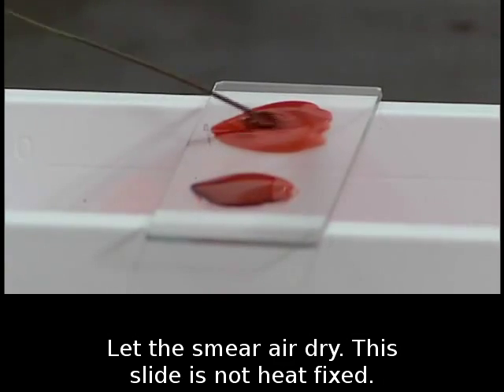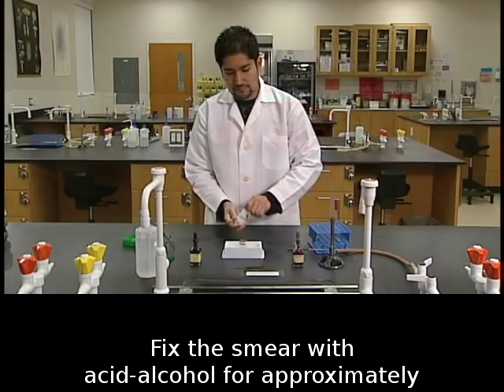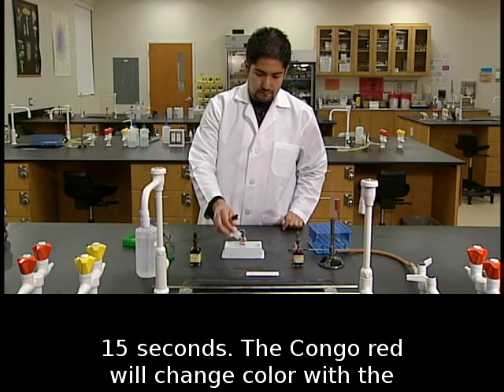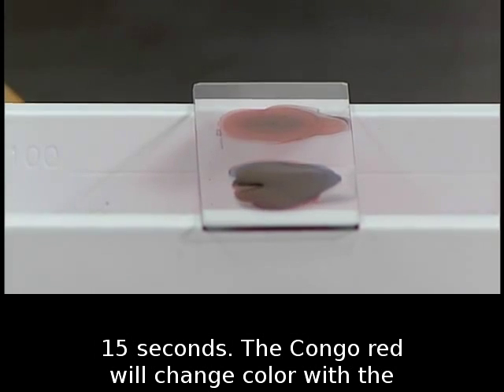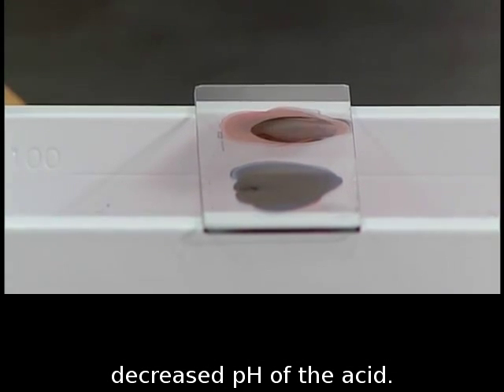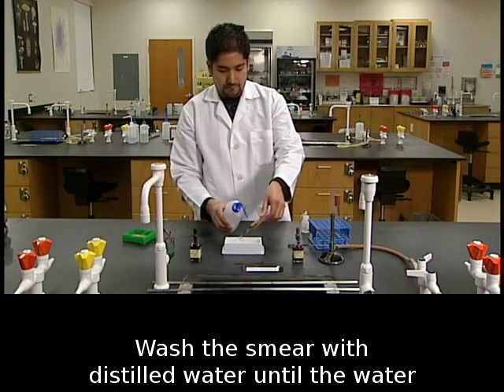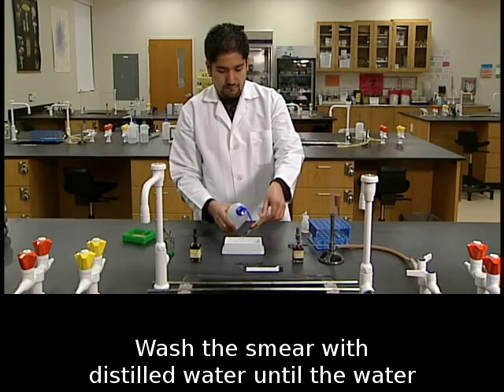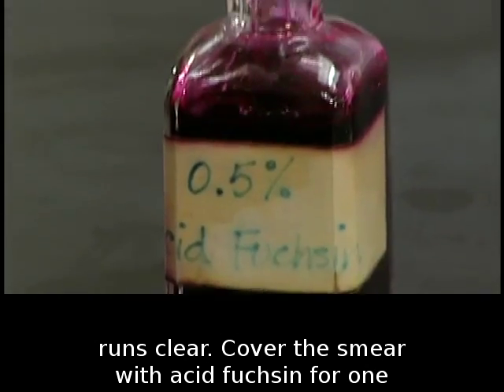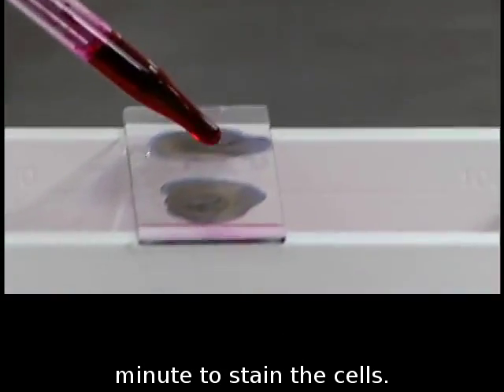Let the smear air dry. This slide is not heat fixed. Fix the smear with acid alcohol for approximately 15 seconds. The Congo Red will change color with the decreased pH of the acid. Wash the smear with distilled water until the water runs clear. Cover the smear with acid fuchsin for one minute to stain the cells.